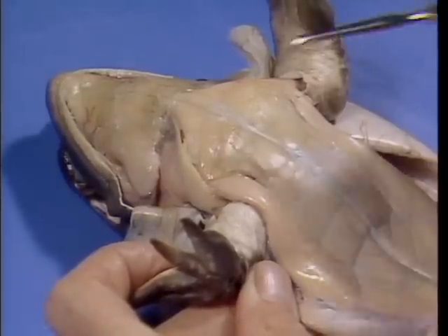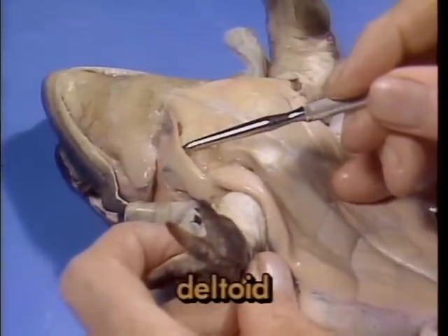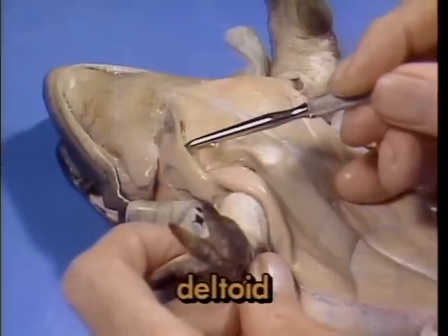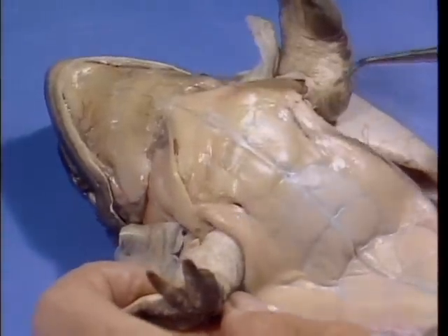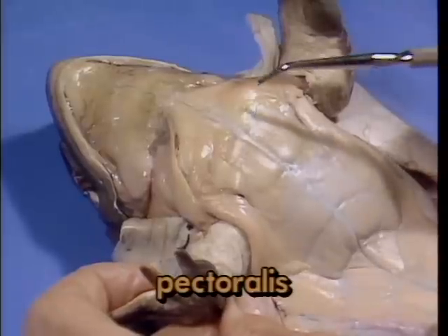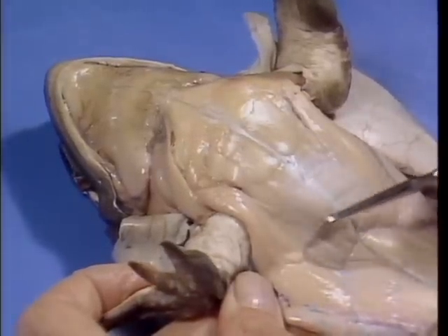Moving posteriorly, note the short muscle on the upper arm. This muscle is the deltoid, which draws the arm forward. Remember, the technical term for this motion is protraction. The large muscle mass here is called the pectoralis. It is made up of 3 components, all of which are involved in movement of the upper arm.